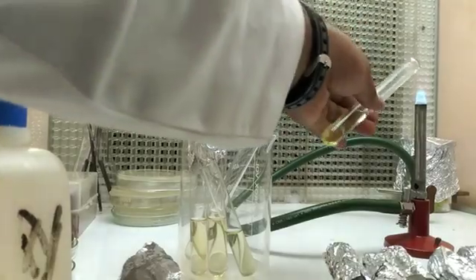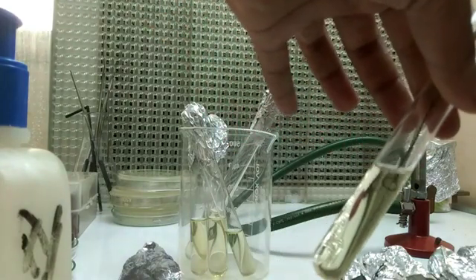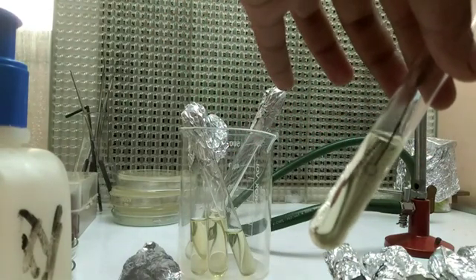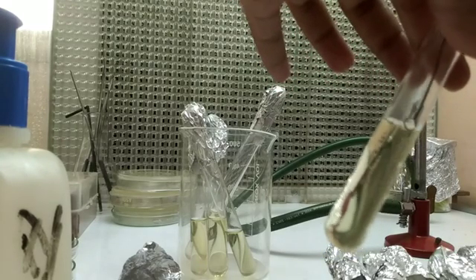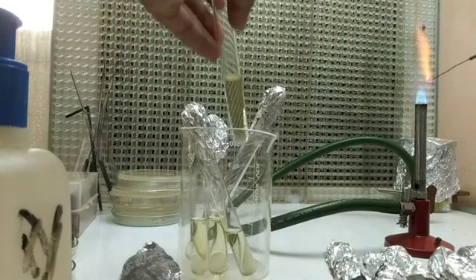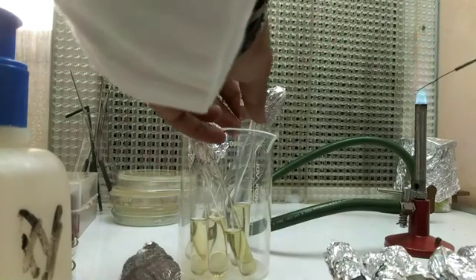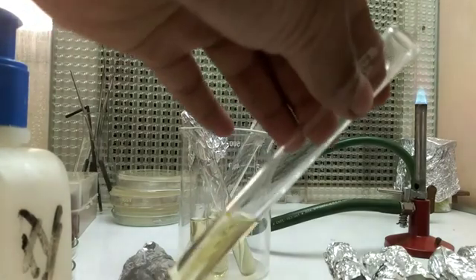Heat the inoculation loop again briefly, then insert it into the nutrient broth test tube and shake it gently so the bacteria enter the broth. After inoculation, sterilize the loop again, replace the cotton plug, and rewrap the test tube with foil.